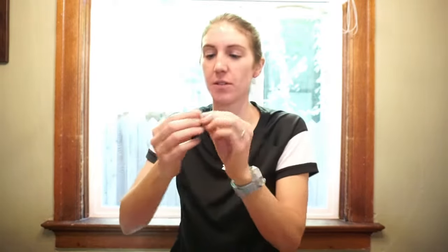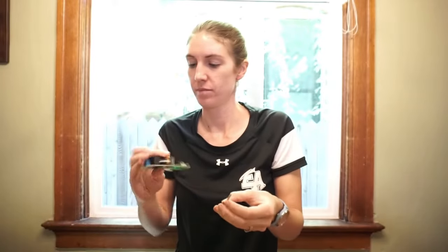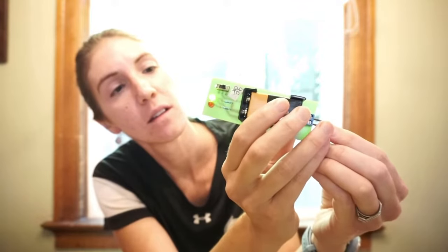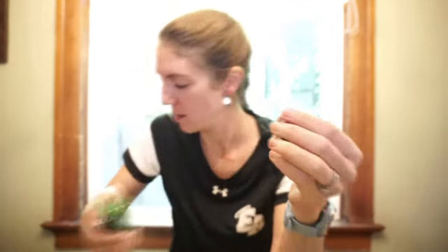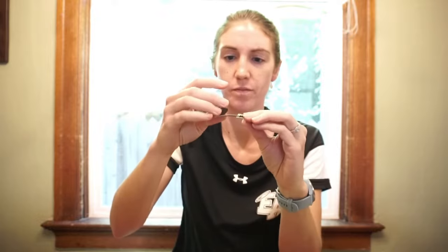Okay, next up we have Mg. That's capital M, lowercase g, right here. So, what do we think? Is it shiny or dull? Can I bend it? Does it conduct electricity? And then last but not least, is it magnetic?